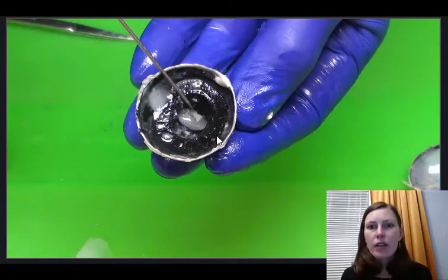Then you see a lot of dark structures, and basically what you're seeing here is the iris that is surrounding this opening right here. So this is an opening called the pupil, and through that pupil we can actually see the back or the inside of the cornea. So this is the cornea, the opening is the pupil, and then the iris is right here.